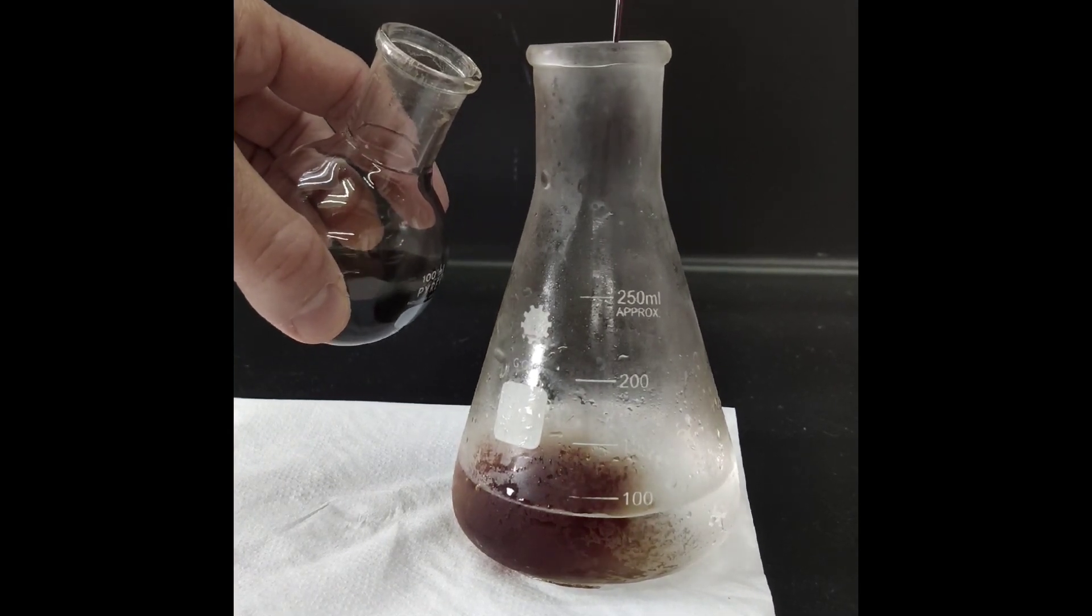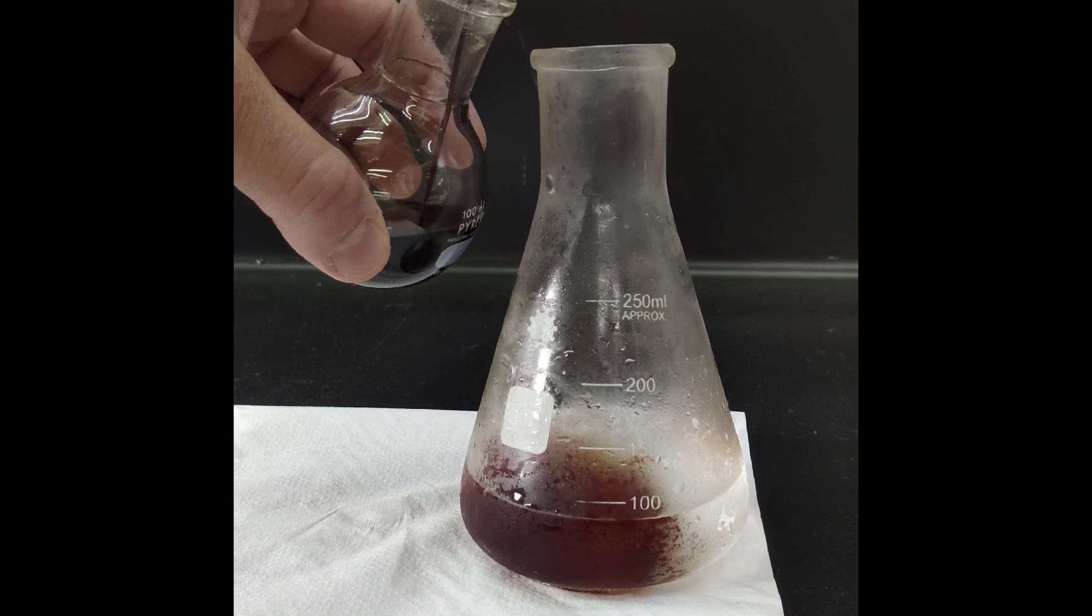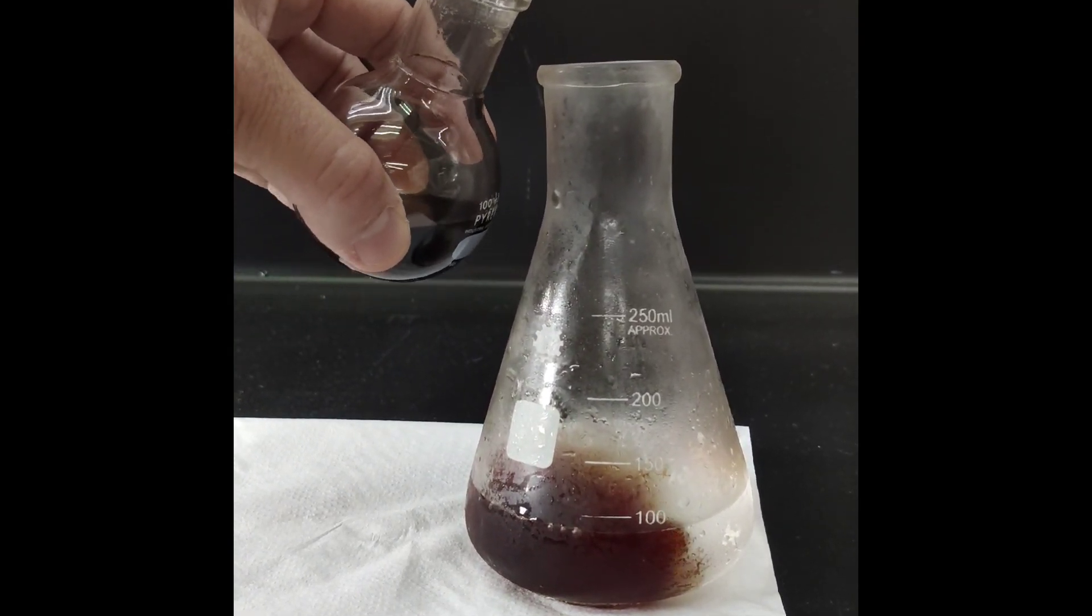We keep pouring the rest of the content of the reaction flask. The red color is nicer to see in person and it means that the reaction has worked pretty well.